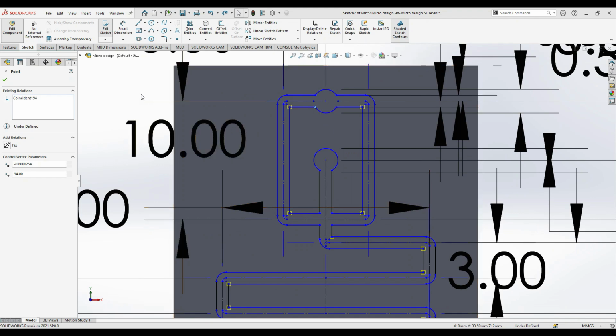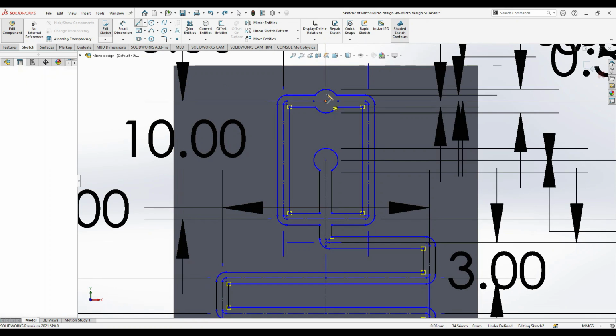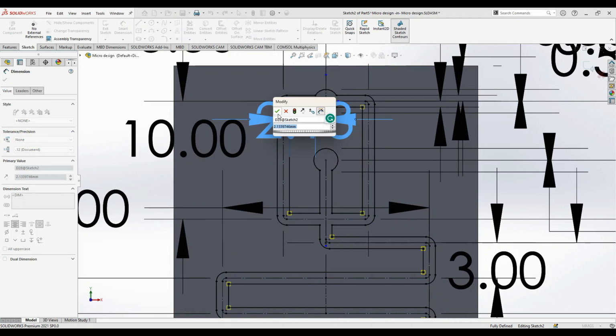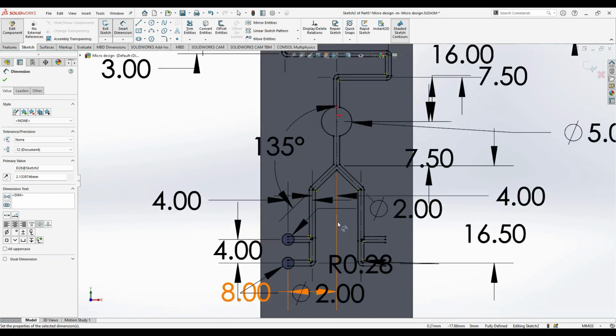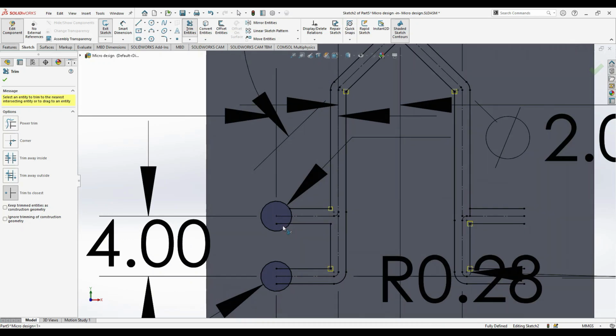So let's try to do some constraints. First of all, just draw a center line. And now you can see that it is constrained, and then just draw the length of this so that the complete movement is constrained, and then just trim these entities. Not required.